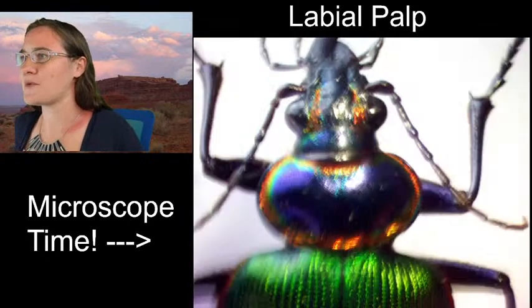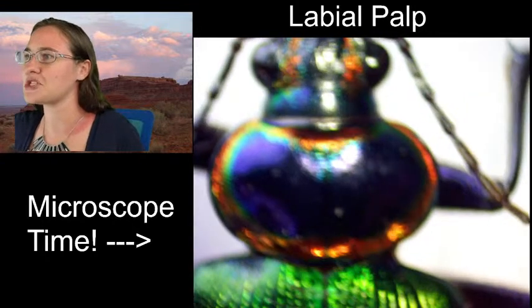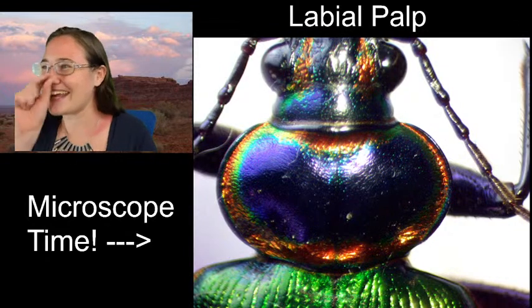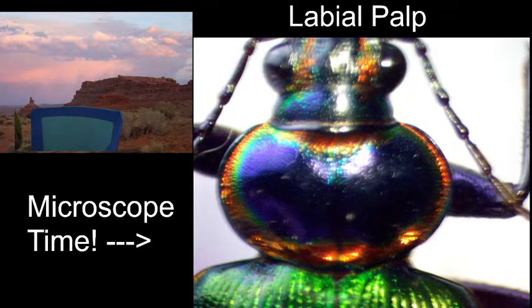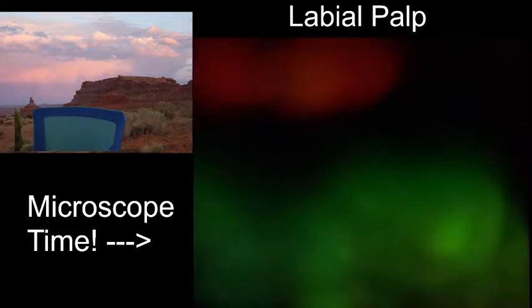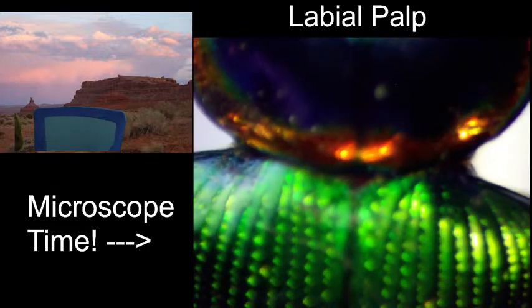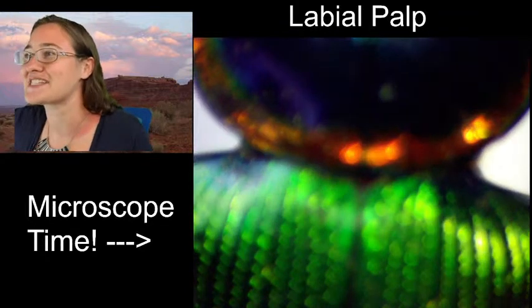All right, I'm going to go ahead and zoom in a little bit on the pronotum just to make sure we've got all of these characteristics right. And I can see an itty bitty scutellum maybe. Does it not have? It's so small, I'm not sure that it exists.